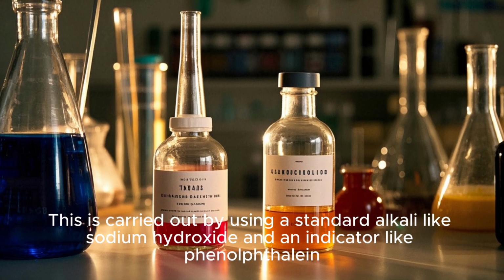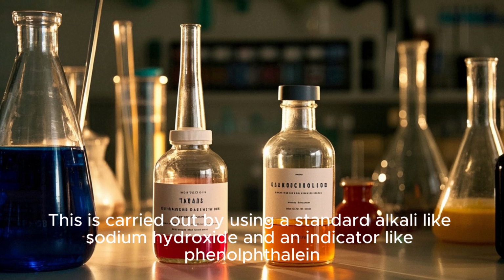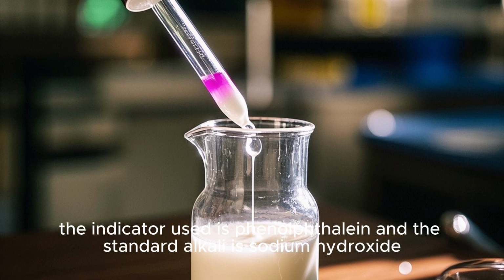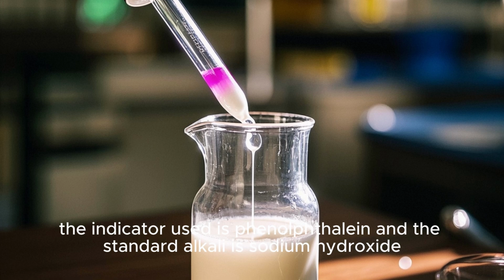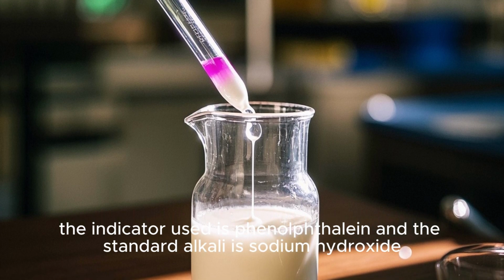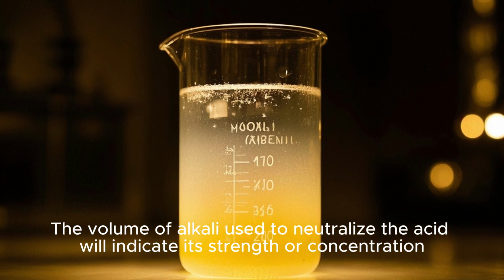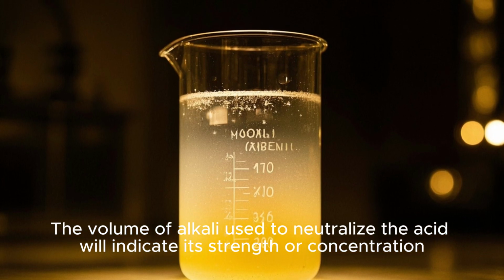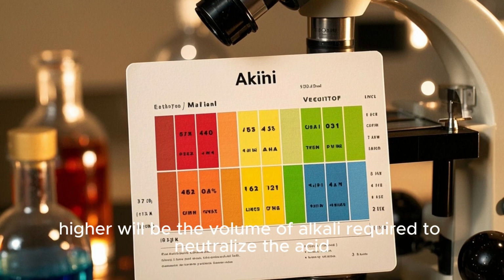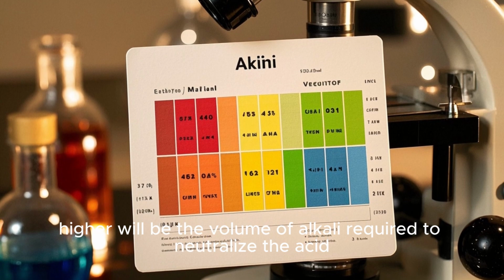This is carried out by using a standard alkali like sodium hydroxide and an indicator like phenolphthalein. In this case, the indicator used is phenolphthalein, and the standard alkali is sodium hydroxide. The volume of alkali used to neutralize the acid will indicate its strength or concentration. Higher the acidity, higher will be the volume of alkali required to neutralize the acid.